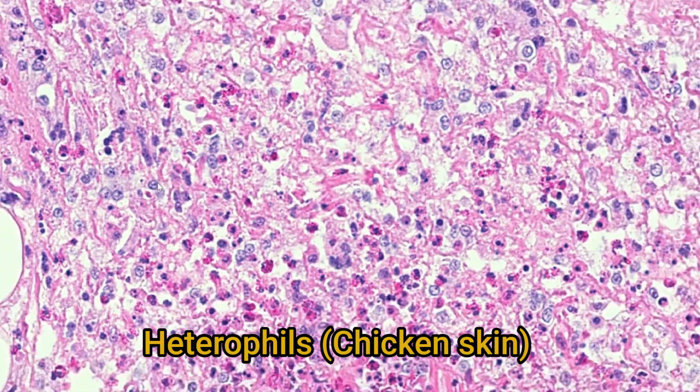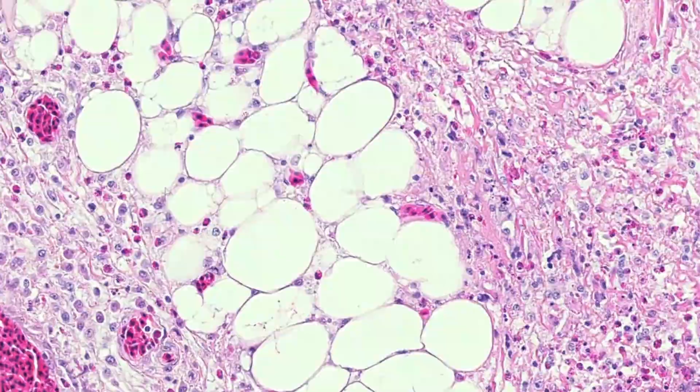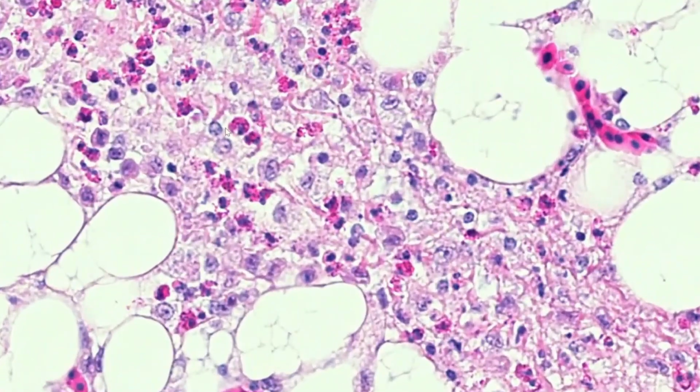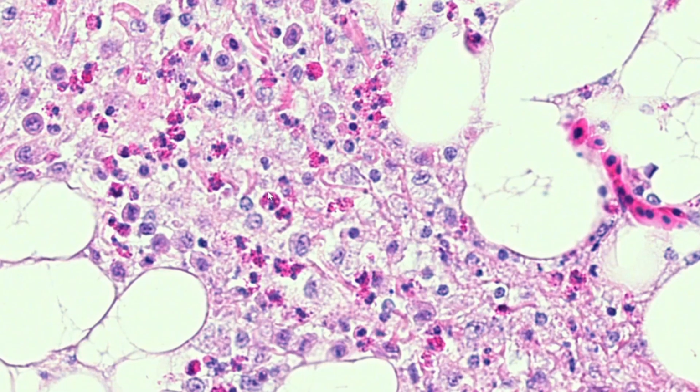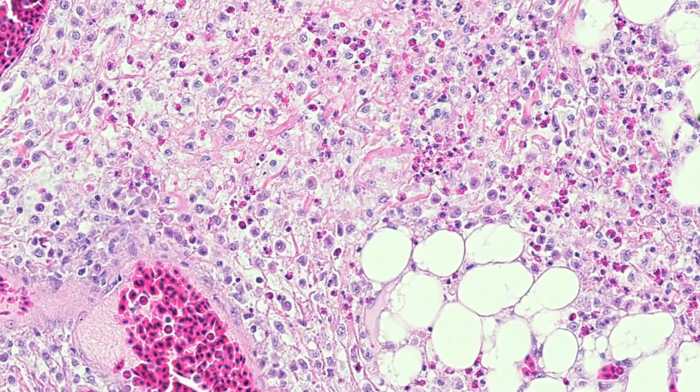And this is a section of skin from a chicken. You can see the nucleated red blood cells that are typical of reptiles and birds. And here are the heterophils. They're these, so they still have that kind of similar size and kind of segmented nucleus appearance, but rather than having the homogeneous cytoplasm, they have these really big pink granules. So they're quite distinctive.